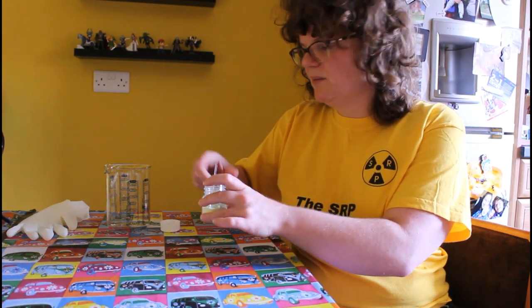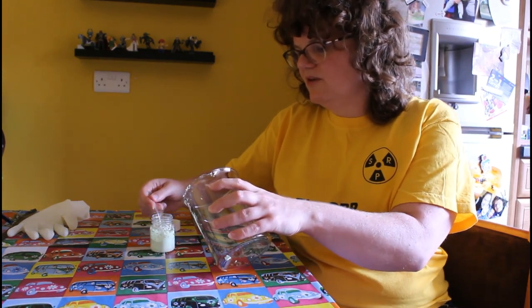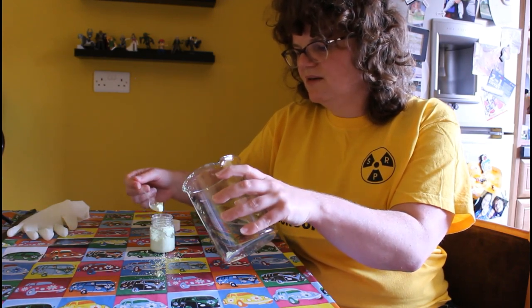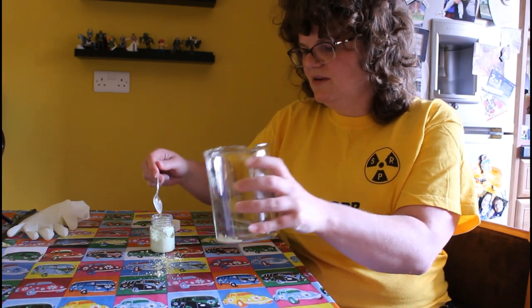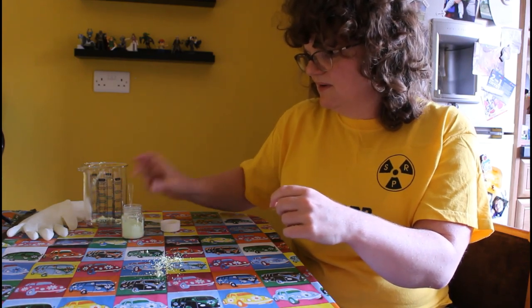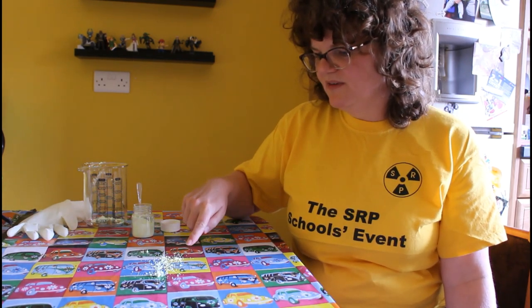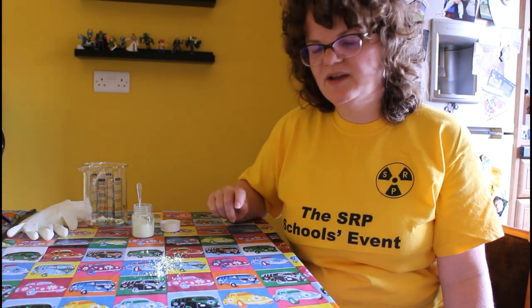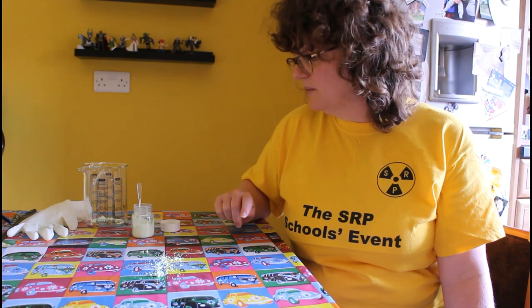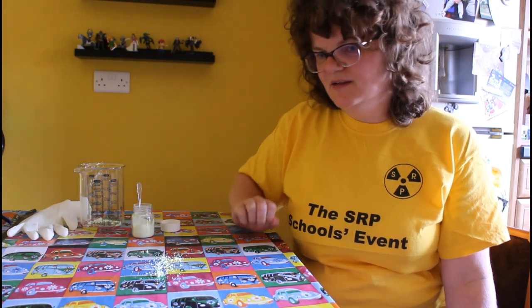Now if I start doing my pretend radio chemistry, I take some of my material and put it in my chemistry beaker. Some of my material that I wanted in my beaker has fallen onto my work surface, and this is what we call contamination — it's the radioactive material in a place where we don't want it to be. The intended place was here but now we've contaminated this work surface.